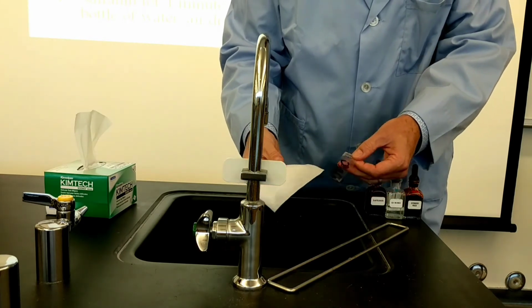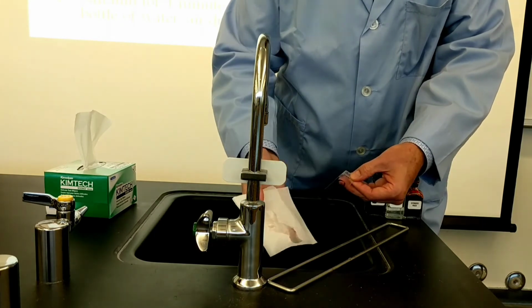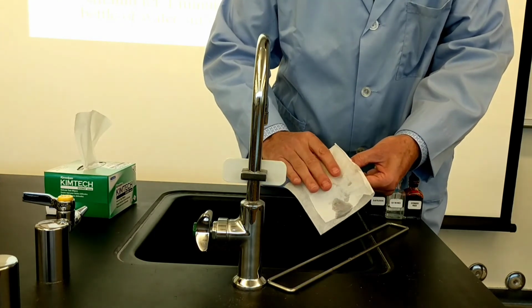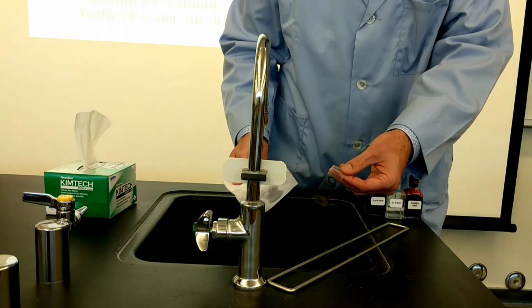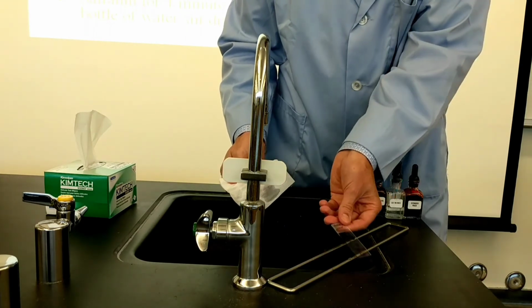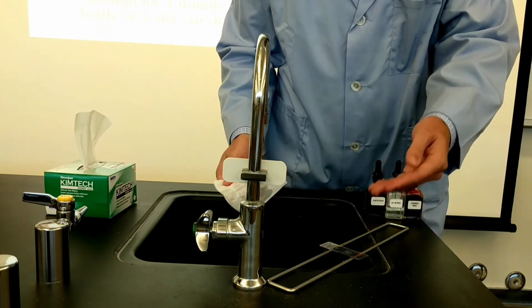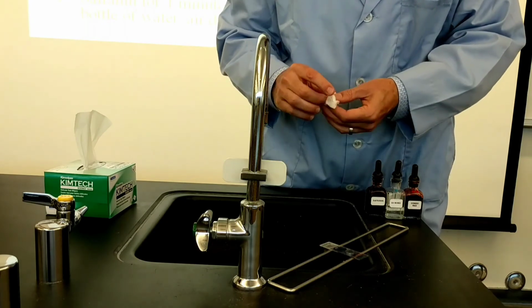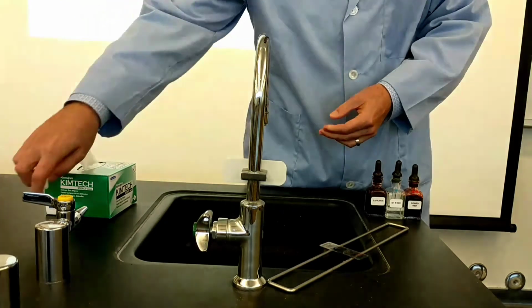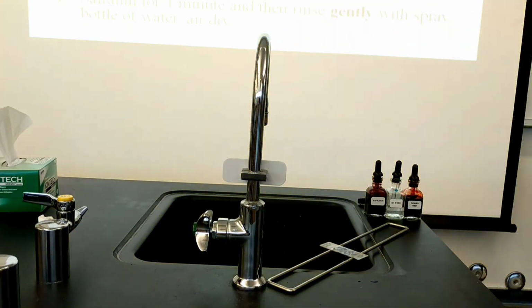So what I'm going to do is take my Kim wipe and just press it down gently and blot it. Maybe I'll do that one more time, and that's about as much as I want to do. Any little bit of leftover moisture is not a problem. This can go under the microscope. No cover slip. You can just go straight to viewing, and you can put oil on there and everything. No problem at all. So that's the capsule stain now completed.